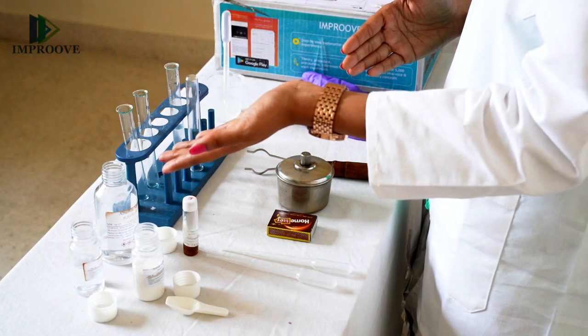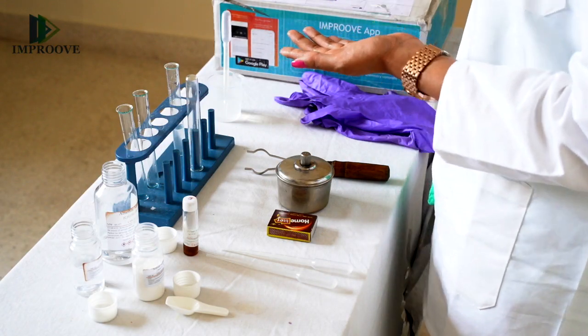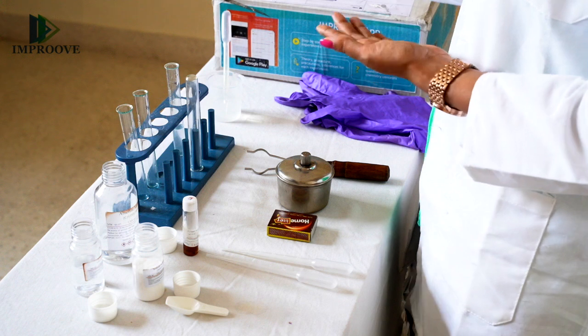In this experiment, we will see the esterification reaction between an alcohol and a carboxylic acid. When a carboxylic acid reacts with alcohols in the presence of concentrated sulfuric acid, it forms esters with loss of water. For example, here, ethanoic acid will be reacting with ethanol to form ethyl ethanoate ester.